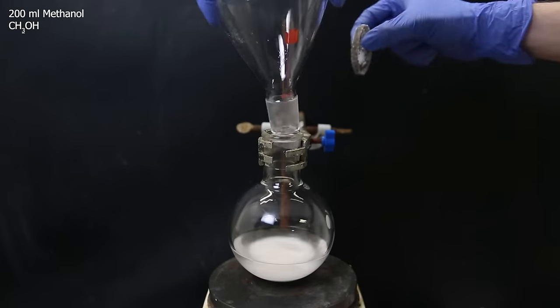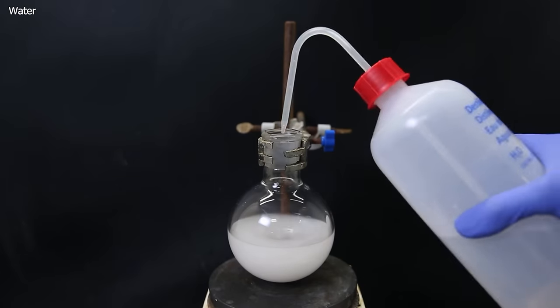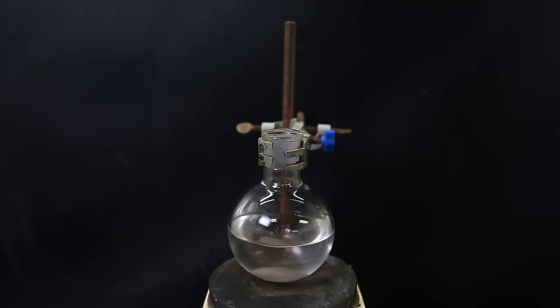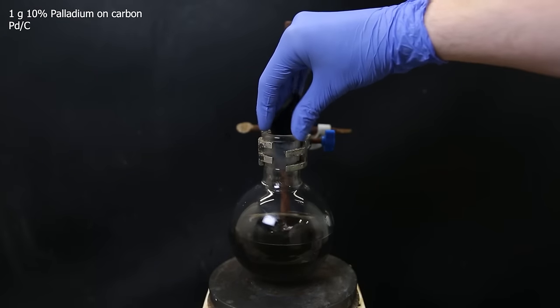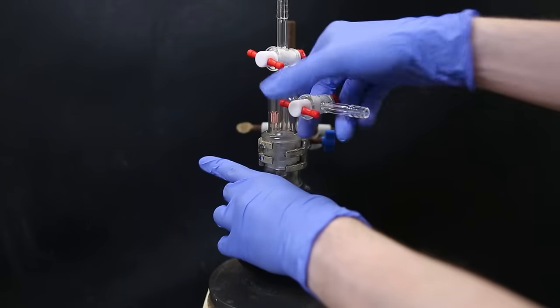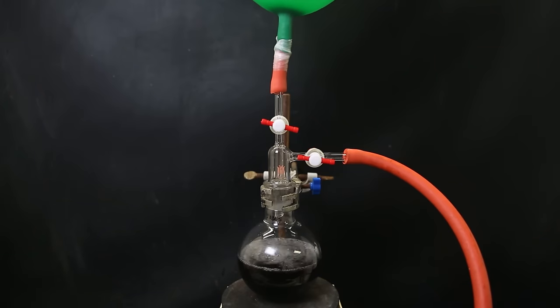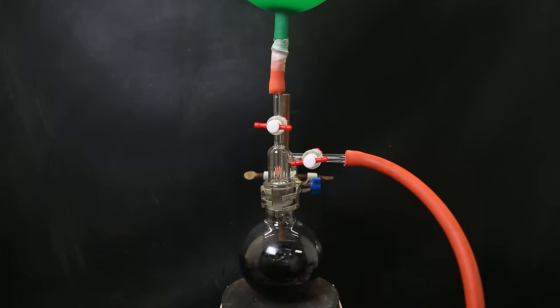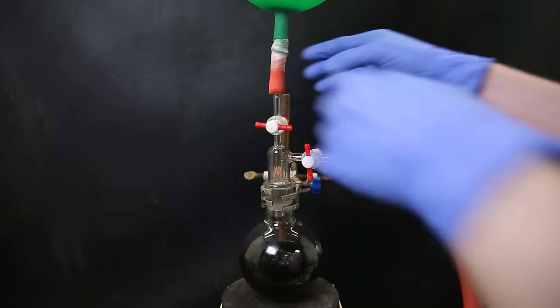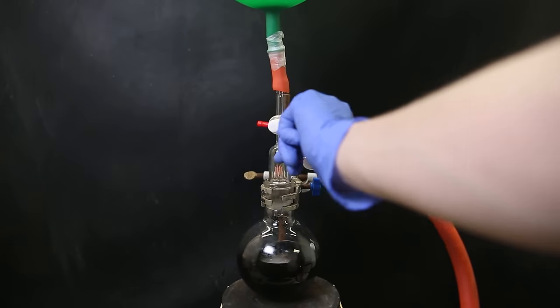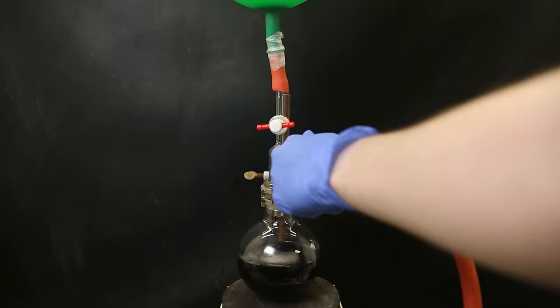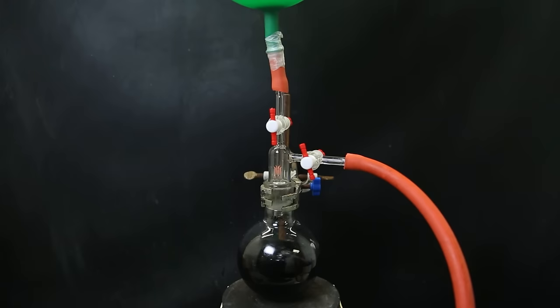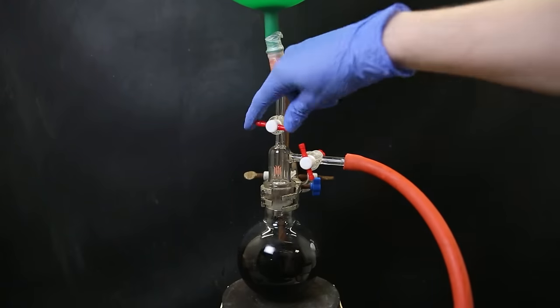Now for the next reaction, I add 200ml of methanol as a solvent, and then a little bit of water to increase its solubility. It then all dissolves, and as a catalyst, I add 1g of 10% palladium on carbon. I then attach a 2-way gas adapter and attach a balloon with nitrogen on top and a vacuum pump on the right. I then cycle, pulling a vacuum and opening the way to the balloon several times to fill the flask completely with nitrogen and make sure pretty much all of the oxygen is removed. I then replace it with a balloon filled with hydrogen and repeat the same process to fill it with hydrogen, and then leave it to react at room temperature with the way open to the hydrogen balloon.